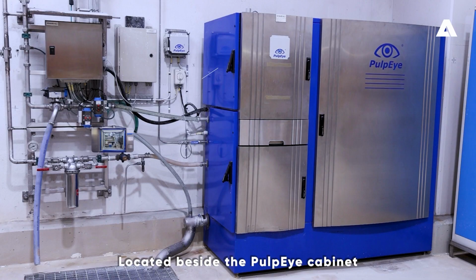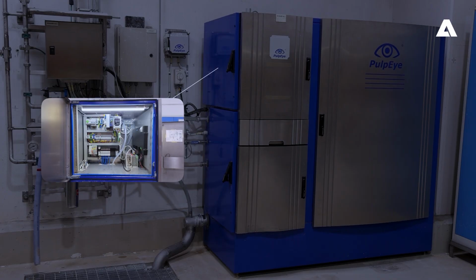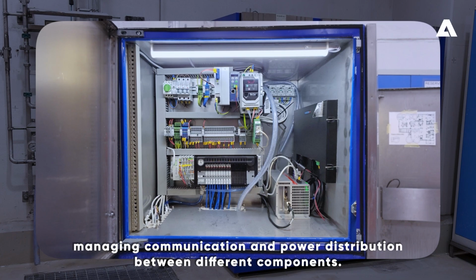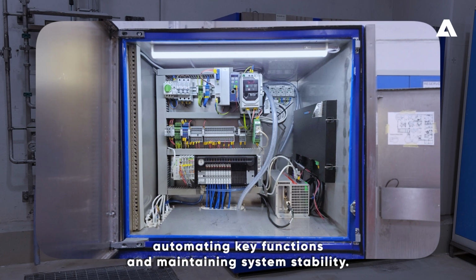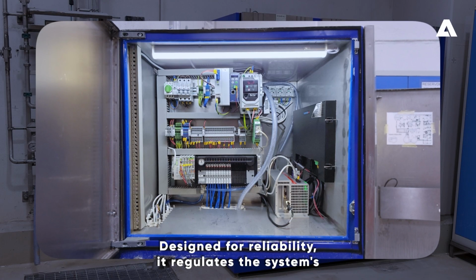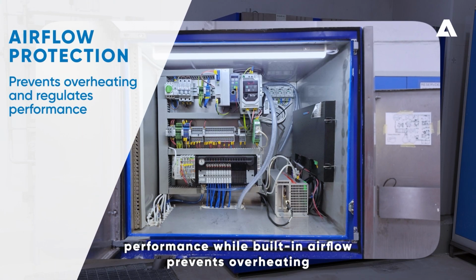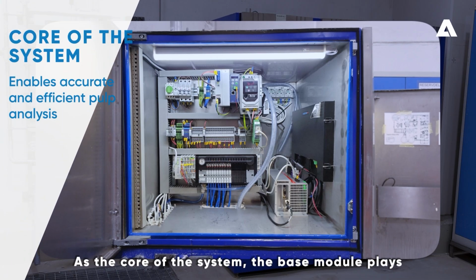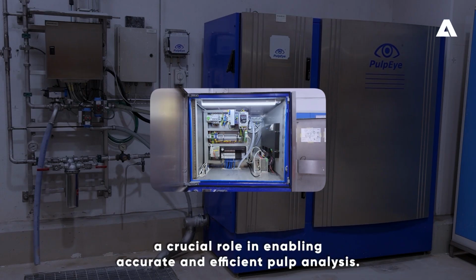Located beside the PulpEye cabinet, the base module is the central control unit of the system, managing communication and power distribution between different components. It ensures smooth operation by processing data, automating key functions, and maintaining system stability. Designed for reliability, it regulates the system's performance while built-in airflow prevents overheating, keeping the electronics protected. As the core of the system, the base module plays a crucial role in enabling accurate and efficient pulp analysis.